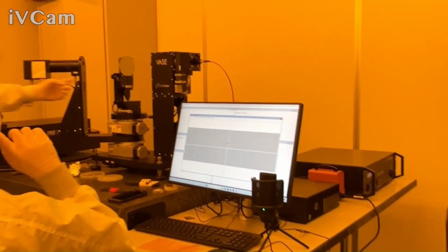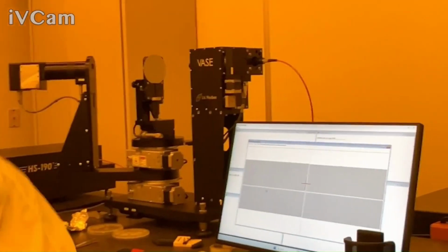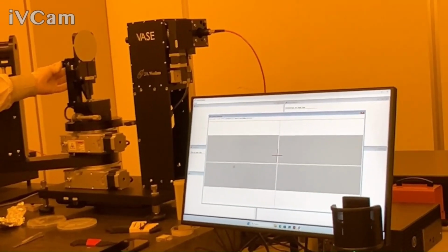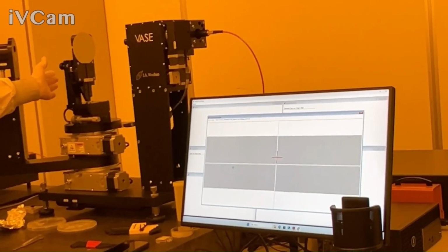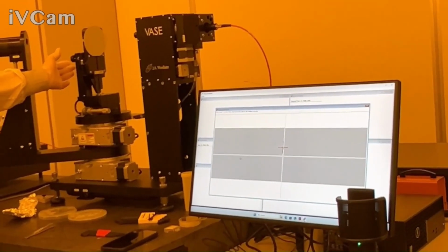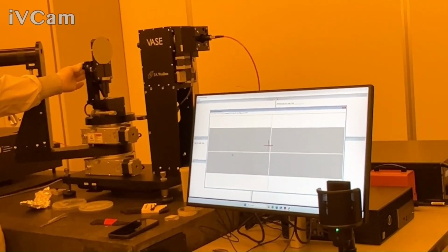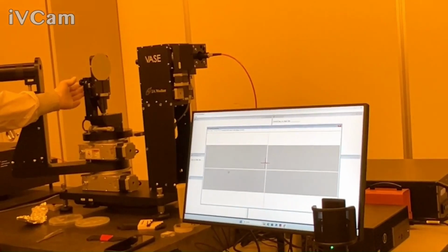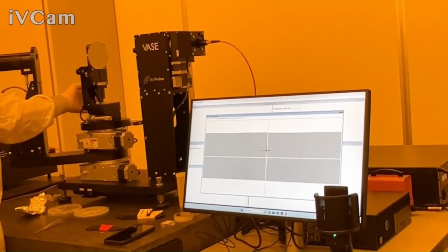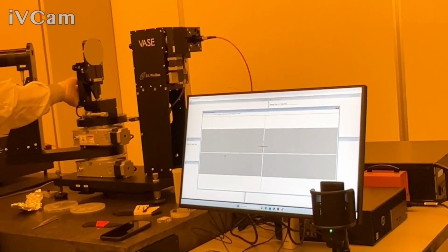So these are going to be these two tilt knobs here. Again, you kind of want to turn it a little bit and then turn a little bit. One will be mainly X, one will be mainly Y, so you get a feel for it. But like I said, it'll do a double step for the update. So if you try to go too fast, you're kind of undoing what you did. The other one's kind of hidden back there.